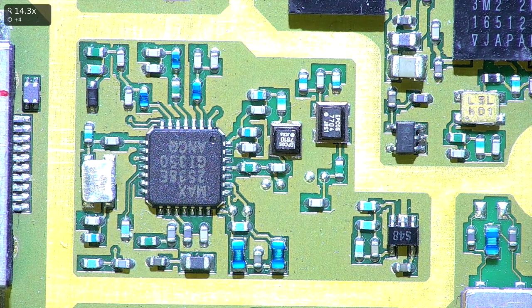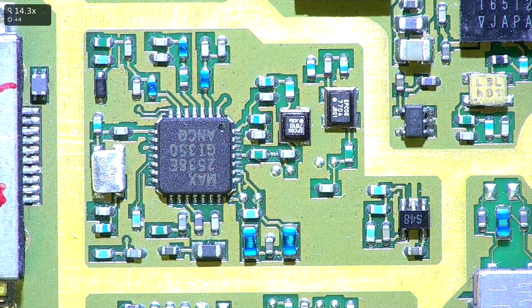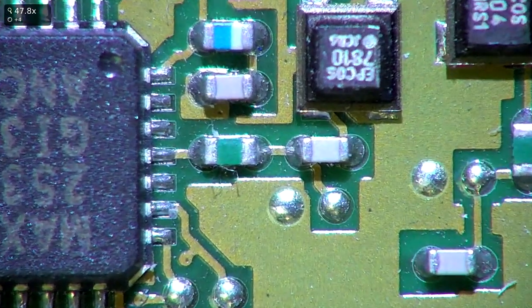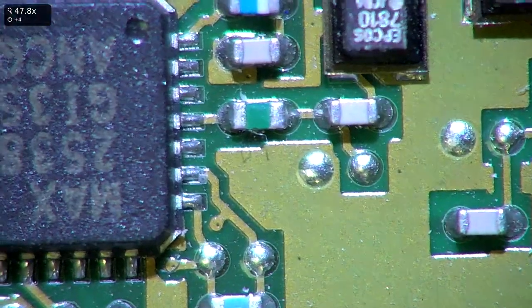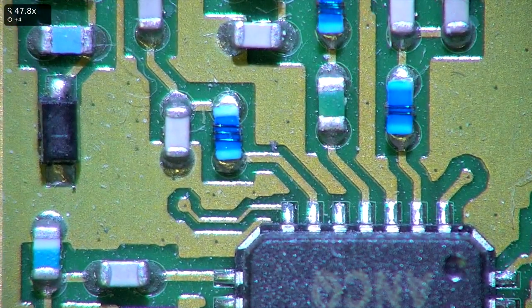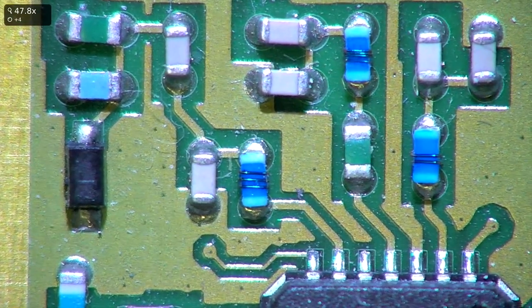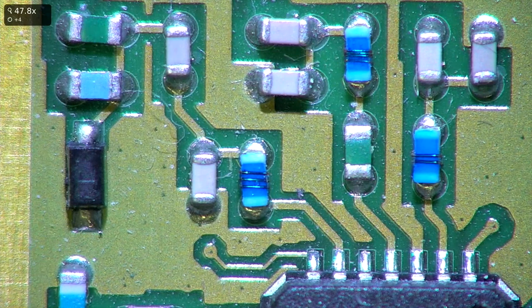But so here we have a board, and we can adjust it here, obviously manually. Here's the zoom. I can zoom in with this lens. I can zoom into about 40x. And we can move around. And one thing I'm fascinated to see on this board are these three inductors here. You can see one with 2 turns, one with 3 turns, and one with 4 turns. So kind of an interesting part.